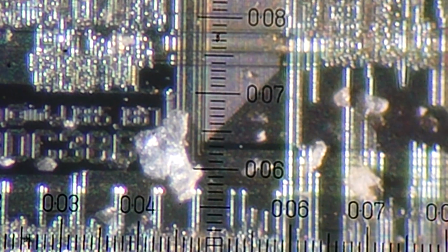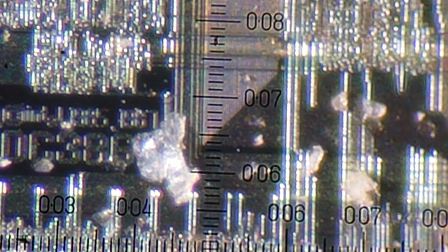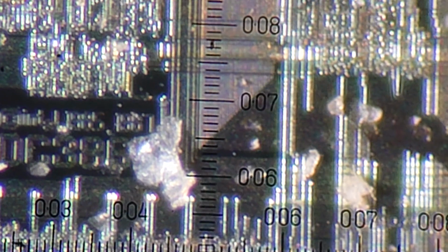And after that, I would say I have learned a new technology of increasing resolution by 8-10%. It's a very huge amount of increased resolution.